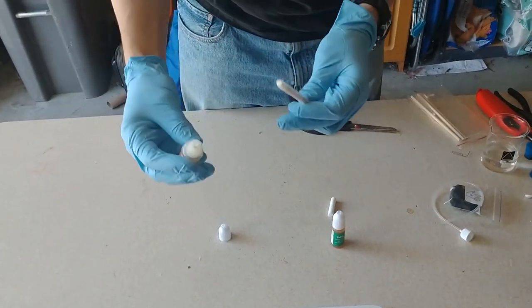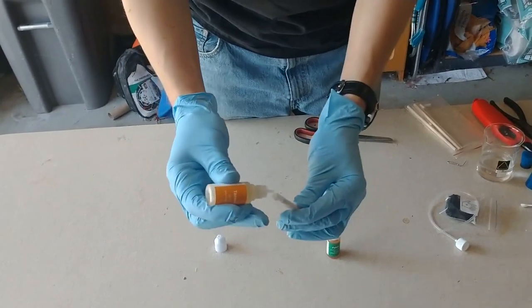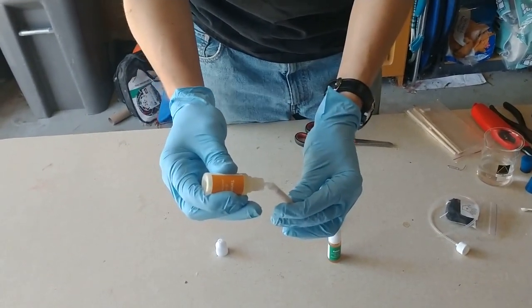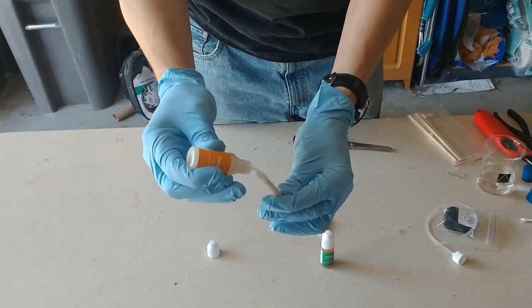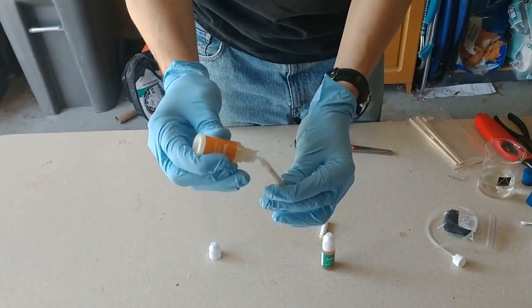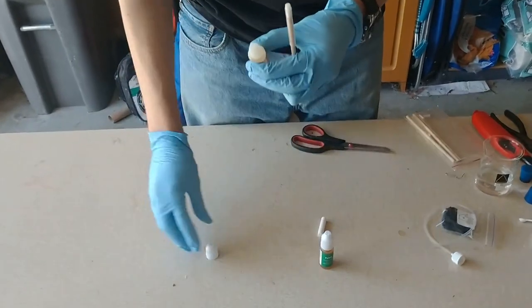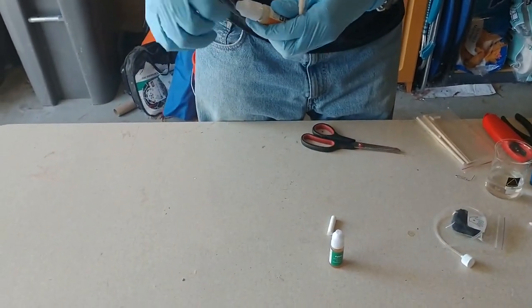I am going to put five drops of the tannin solution on this pen. One, two, three, four, five there we go. That's all I'm going to need.